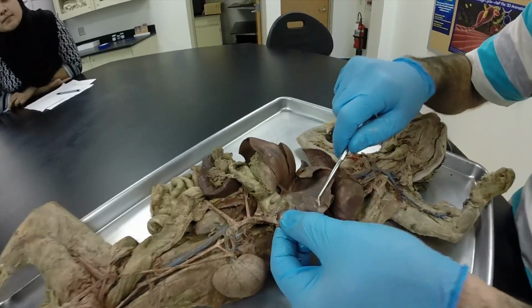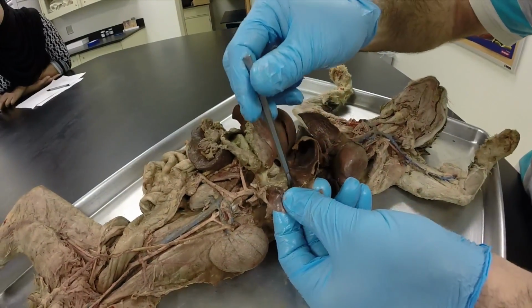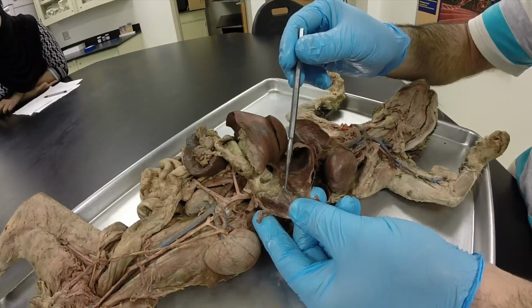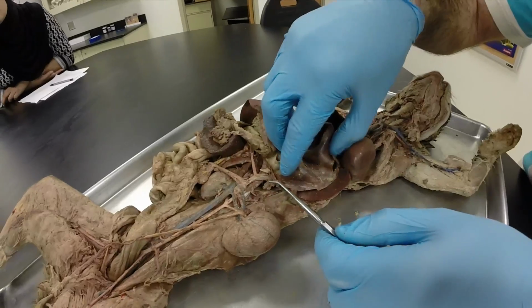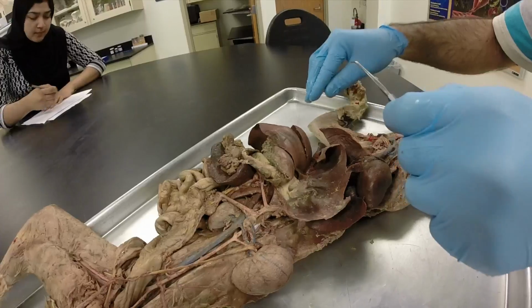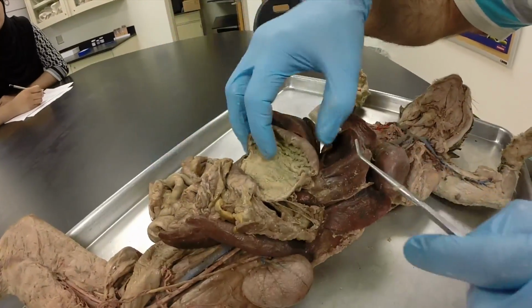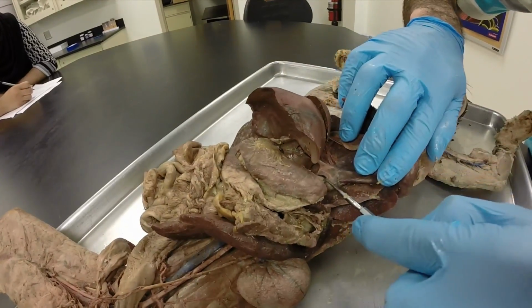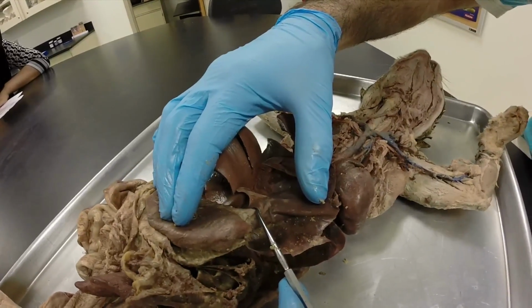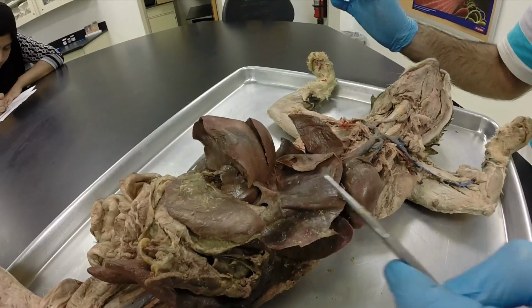So this is kind of hard to understand, but this is our diaphragm, right? And so if I poke a hole in this thing, and let's say the aorta is going through the hole, well, if I pull the hole out, that would be the aortic hiatus. And so the aortic hiatus is literally the hole in the diaphragm that the aorta passes through. And the esophageal hiatus, same deal. It's the hole in the diaphragm that the esophagus passes through. So right there would be your esophageal hiatus, right there. See that? And again, it's kind of hard to see because the esophagus is in the way right now.